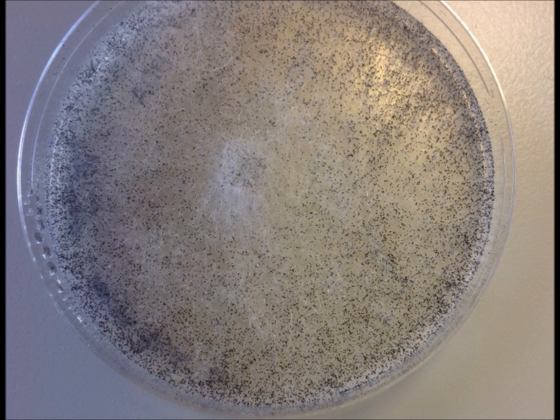You'll easily be able to see the spores with the naked eye. They're the black dots that you can see. There are in fact two types of spore: the small aerial spores and then deeper, closer to the surface of the agar, are the sexual structures, the zygospores, and it's those that we want to study.